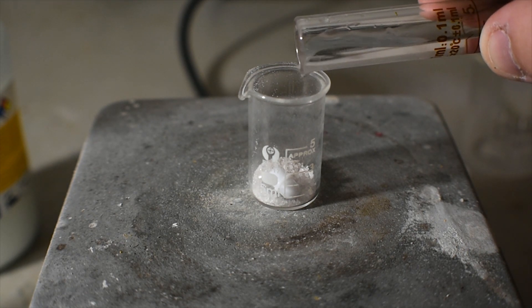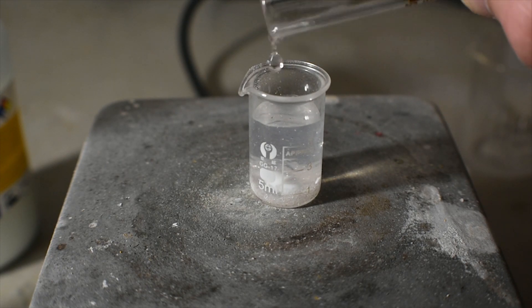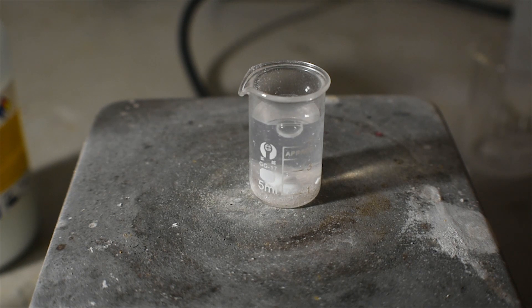Regardless though, we are starting out now by dissolving silver nitrate in distilled water. This is going to be our source of silver for this reaction.